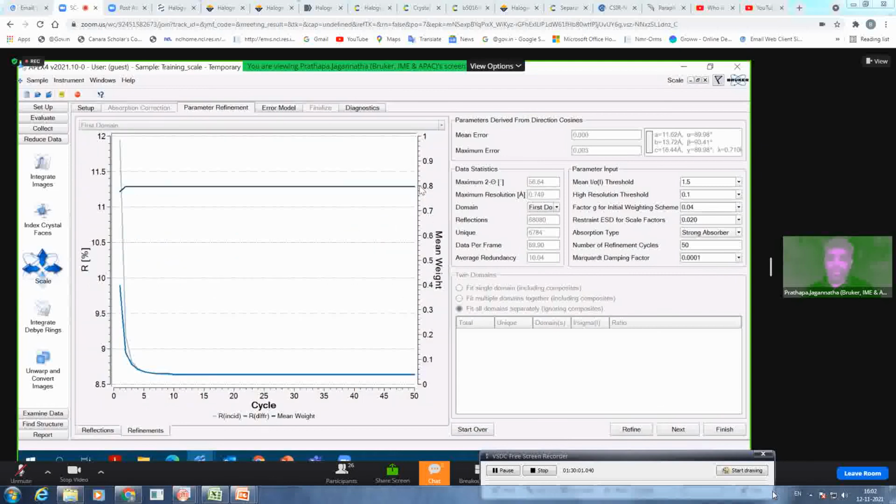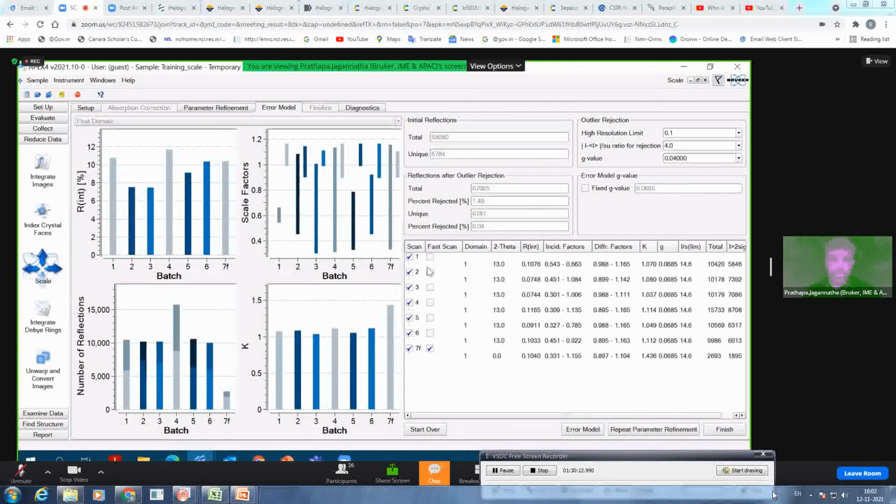Yes, I could go up to 0.8. So really, it helped me get back those reflections, and overall the scaling looks much better now for very turbulent data. And if I look at the R internal now, it's all around 10%, which should be the case in all runs actually. If there is too much variation between the runs, then you know there is something happening with that particular run. So now it looks good. So finish.